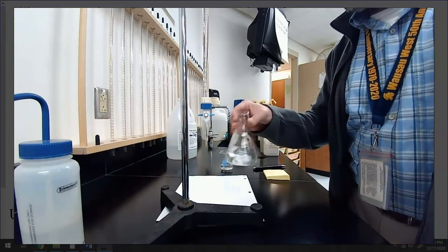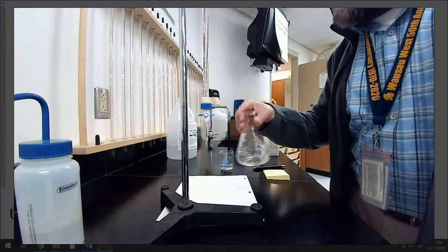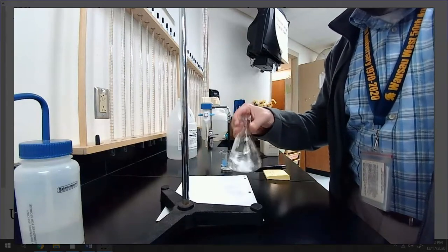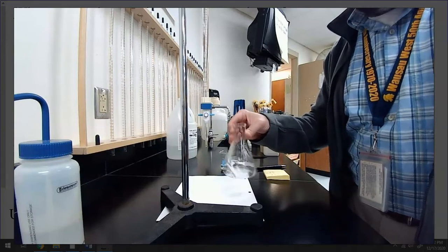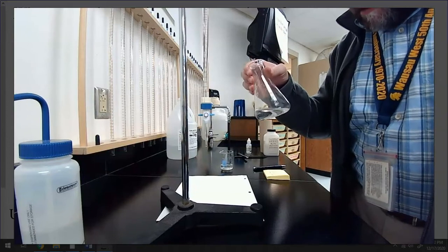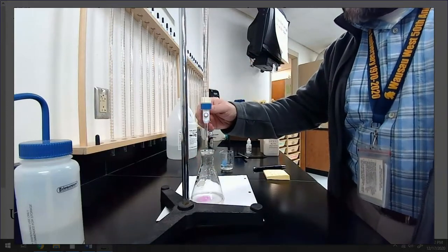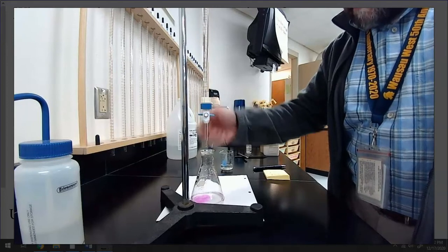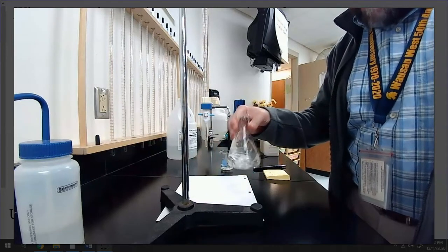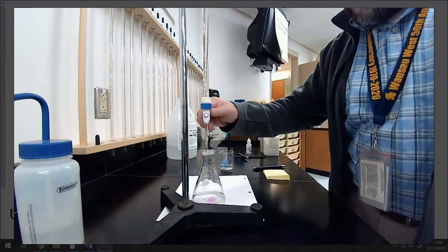So I knew that from the first trial, it took about 13 milliliters. I had just added about like 10 and a half right there. And I wasn't too worried because I knew exactly how much I should need from the previous trial. I'm swirling this to make sure all my solid acid dissolves. There's still a little bit left in there. We'll keep going here. Add another milliliter or two. And again, this should be safe because of the math that I've done previously. I know that this should be a safe amount still.